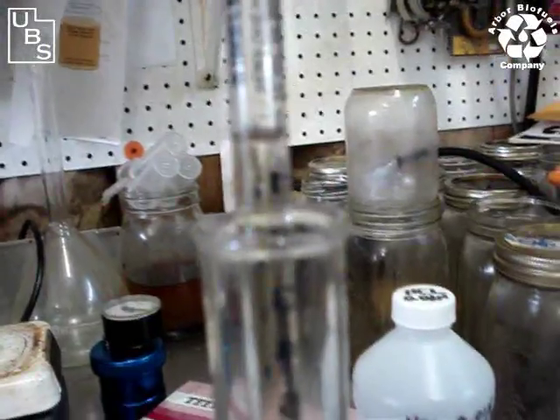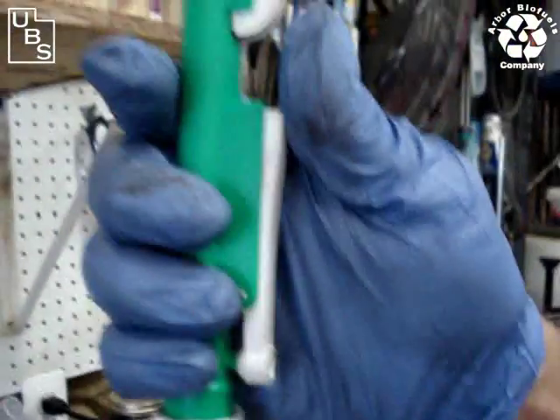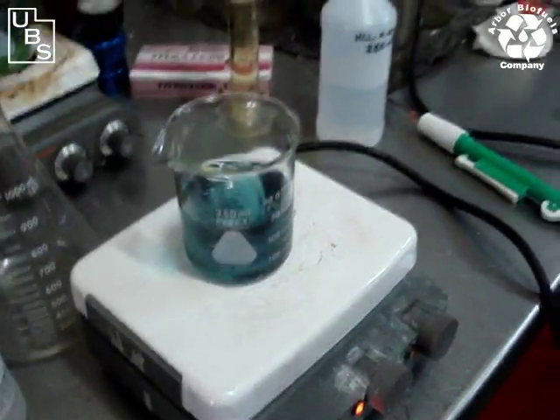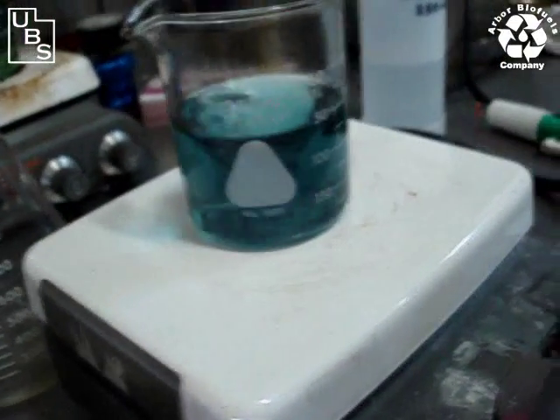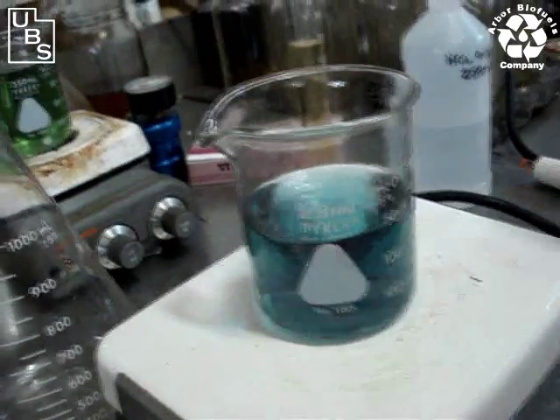Right there, as you can see, I have just a little more than 10 — so there it is, exactly 10. I keep it close to the alcohol, just drop over, and there's a little release handle — I just push the release handle in and it drops the sample. So right now we have the 100 milliliters of isopropyl alcohol, the bromophenol blue is in there, and we've also added 10 milliliters of the last flushing — the fifth flush methanol. Now we're going to titrate it to see if there's any soap still coming out of the column.